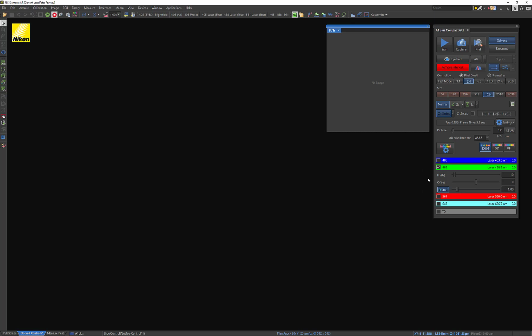And that's going to be dictated mostly by how much signal you're pumping into your fluorophores. What our objective here is to find sort of the best gain in the detector and the best laser power to get a high number of photons without photobleaching. Now, of course, there's other settings that affect your overall detectable photons. They just don't have maybe as large of an effect as these will in your experiments.